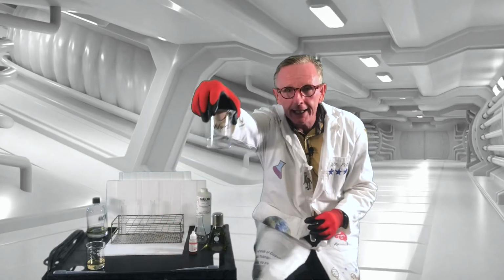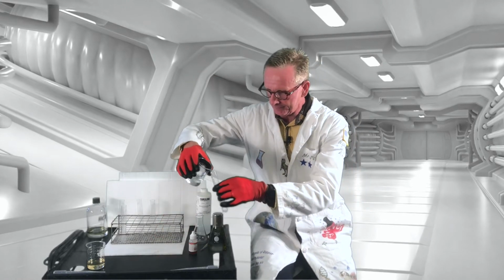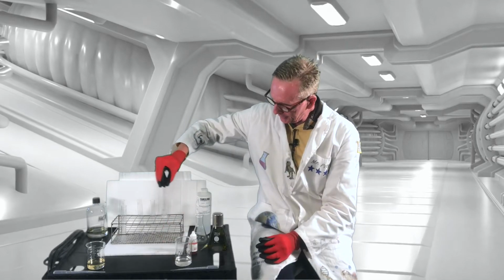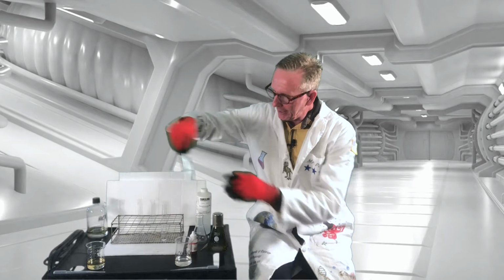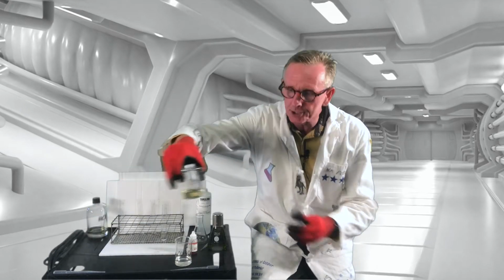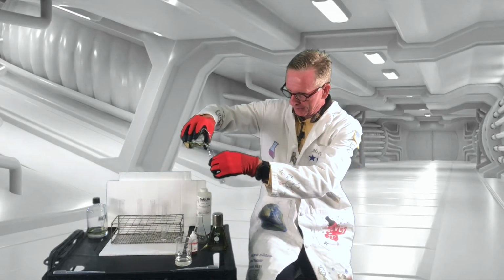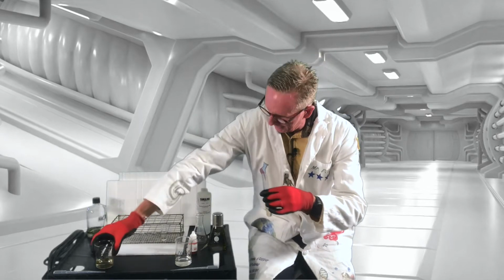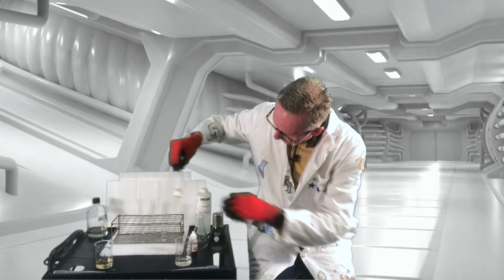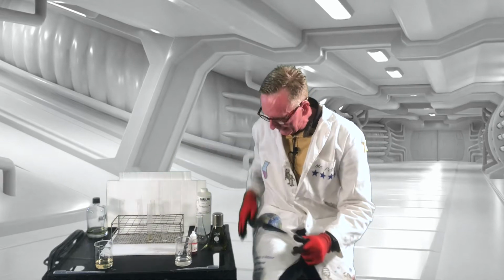Over here, this is the NaOH, sodium hydroxide. And we're going to add some into solution here. And over here I have my hydrochloric acid, or HCl. And we're going to add about the same amount there. Now let's kind of check. Now fortunately the hydrochloric acid is a bit of a color difference, making it easy.